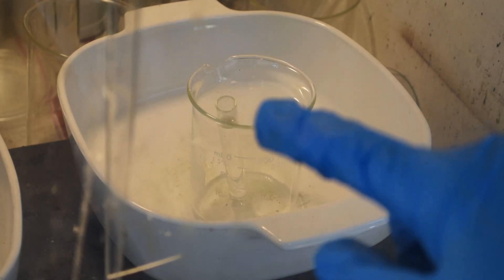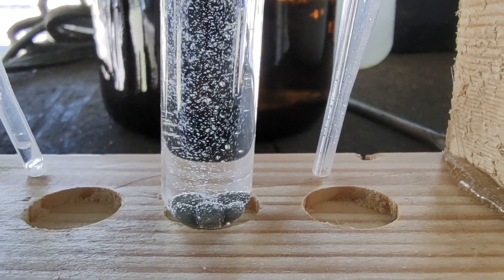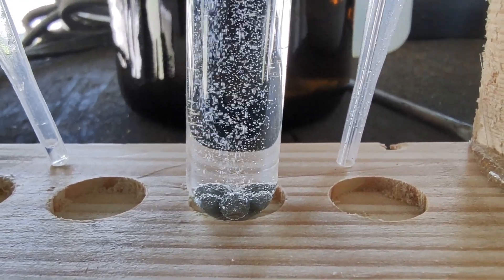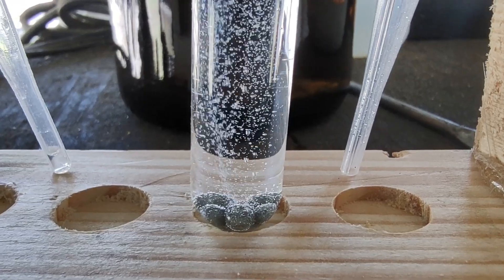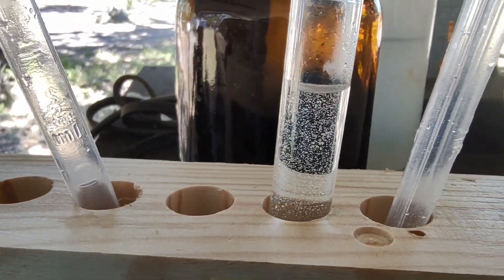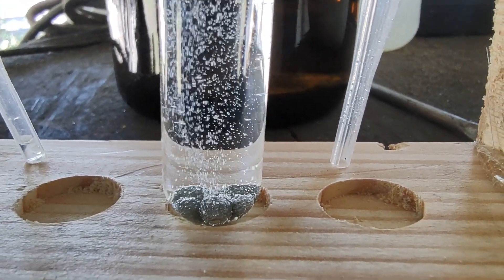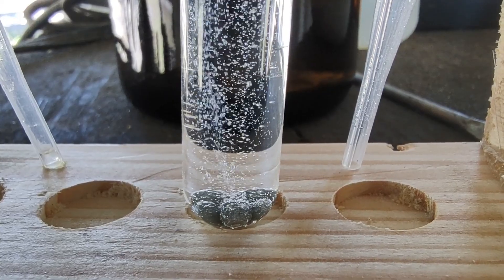The reason why I didn't fill the test tube up any higher than this — I'll show you once this warms up. Now that things have warmed up a bit, that's a much more vigorous reaction. That'll get some stannous chloride in solution quicker. Don't boil it — just warm it up and the reaction will take off. The reason I didn't fill this up all the way is because this reaction can get so vigorous that the bubbles will start pushing the liquid out the top of the tube. So leave a little airspace at the top so the hydrogen bubbles coming off don't push stuff out of the tube.